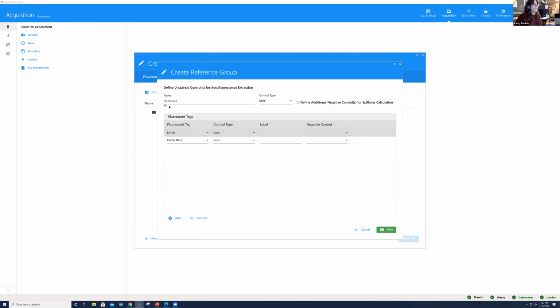No matter what, we always need to make sure we run an unstained sample that is the same cell type as our experimental samples. So we have these unstained cells right here. And then under fluorescent tags, we see that we have the option to choose between cells and beads. Okay. So our single colors today are with cells.